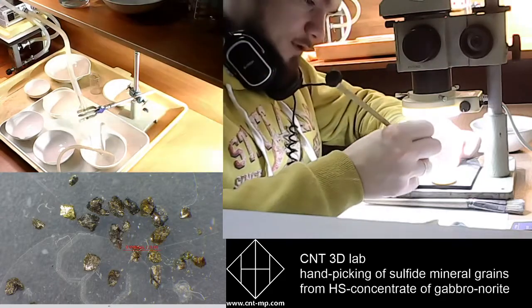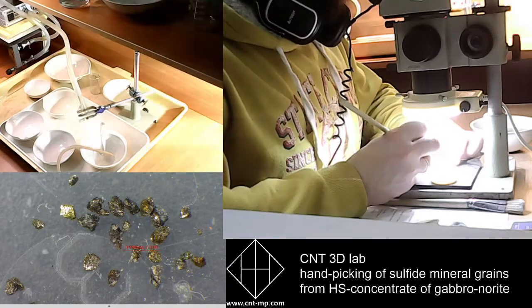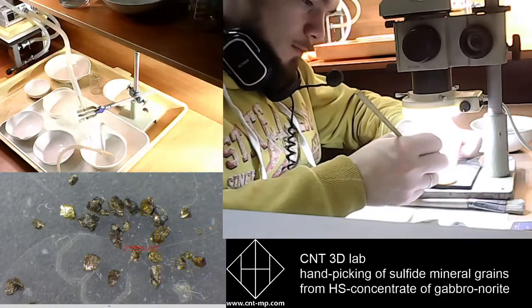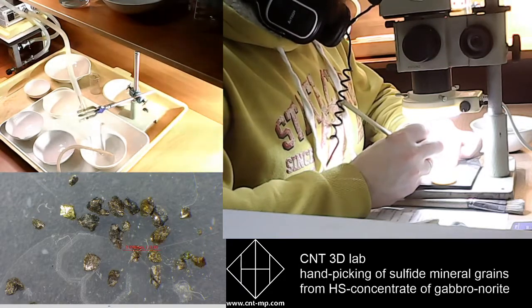45. There are 5 grains of sulfide left. Oh, it stayed there. Just a moment.